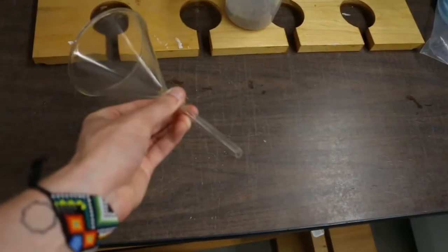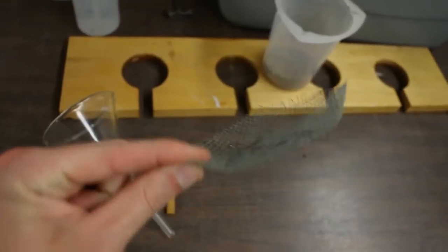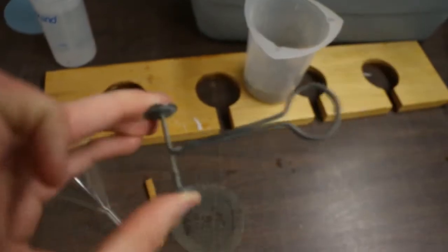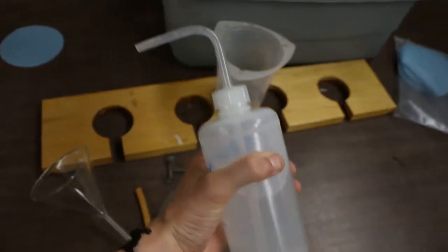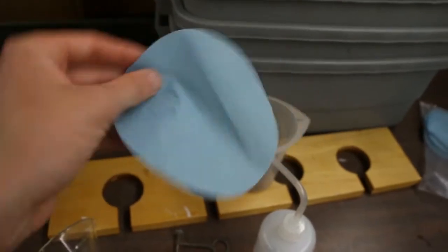First, you'll need a glass funnel, a rubber tube, circular wire mesh, a clamp, a bottle of water, and circular filter paper. And don't forget your soil.